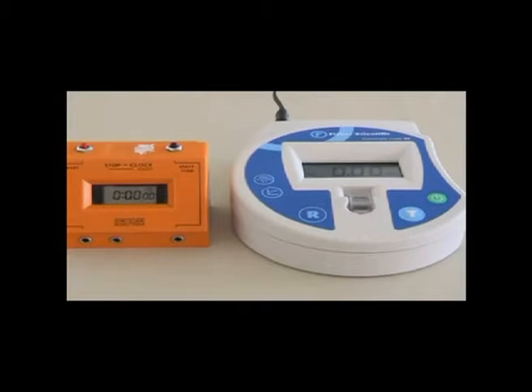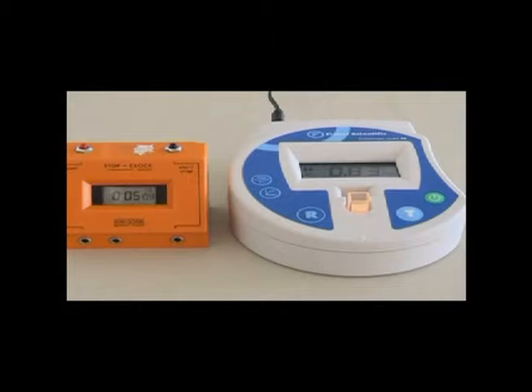The cuvette is then placed in the cuvette holder of a colorimeter and the clock is started. The colorimeter reading at the moment is 0.82, just fluctuating between 0.82 and 0.83. These are absorbance units. In other words, a measure of how much of the light the cloudy solution is absorbing. As the protease enzyme digests the protein in the milk powder, it becomes less cloudy, and you can see the reading going down. After 35 seconds the reading was down to 0.76 units.